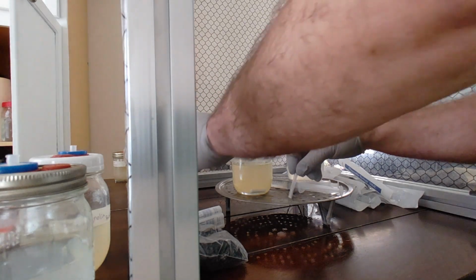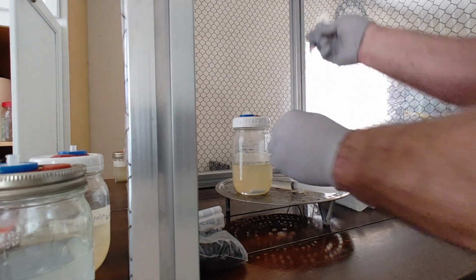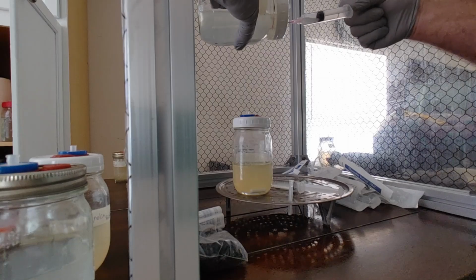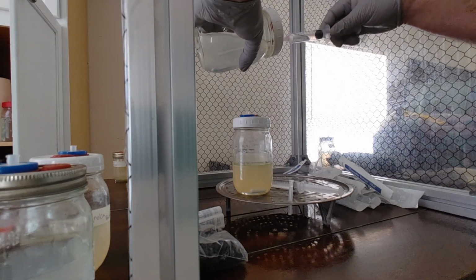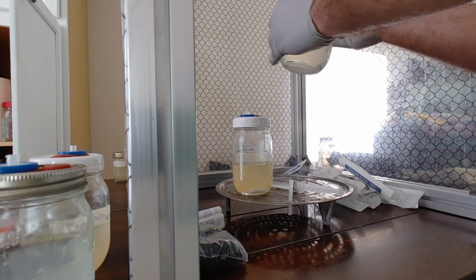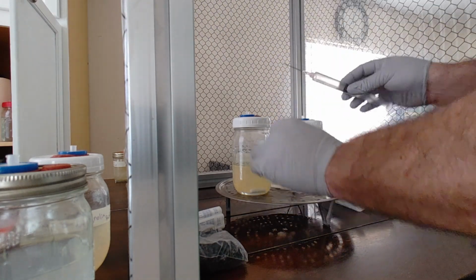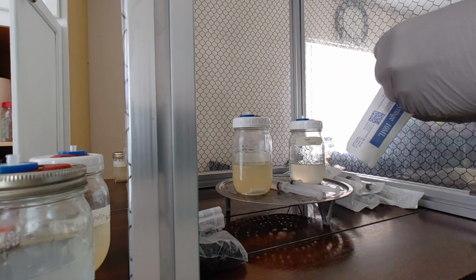We're going to repeat the same steps. Put the needle on, pull the cap, right in the middle, and pull. There we go. I'm gonna do three for each, so you get a triple show here.